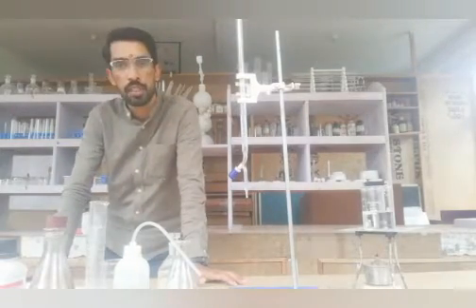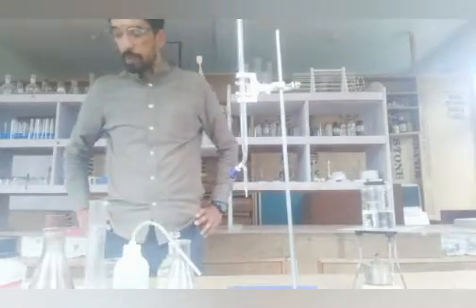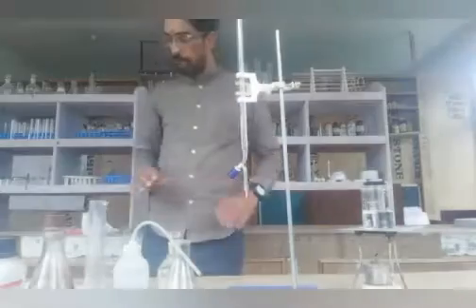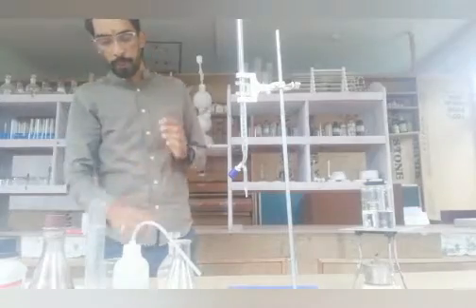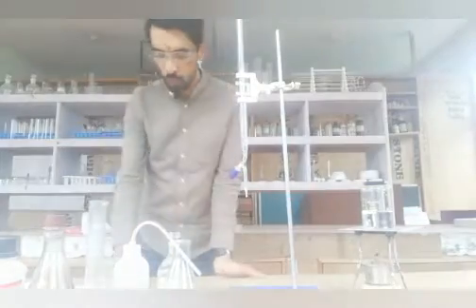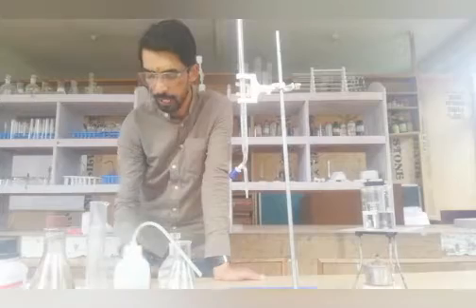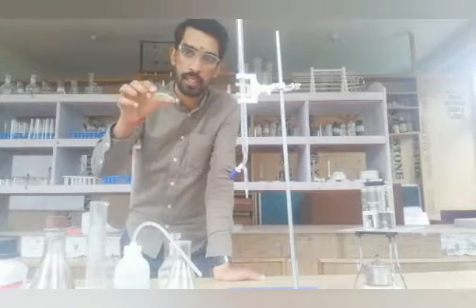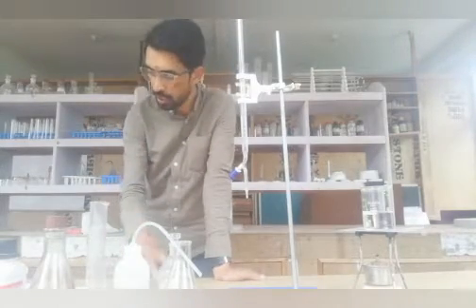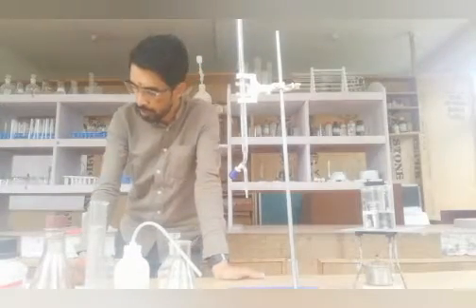Let's start the procedure. First, to prepare the M/50 ferrous ammonium sulphate solution, we need to weigh exactly 1.96 grams of Mohr's Salt. I have already done that — 1.96 grams of Mohr's Salt is inside on this watch glass. We have taken it in a clean and dry watch glass.